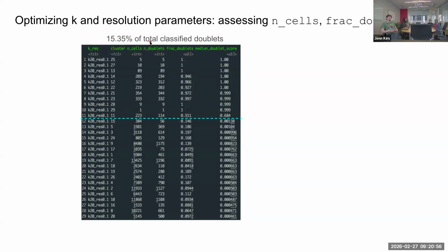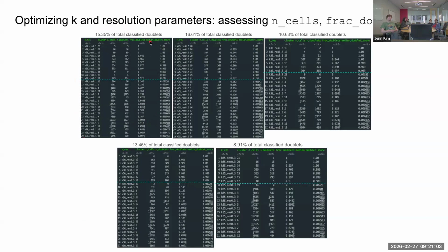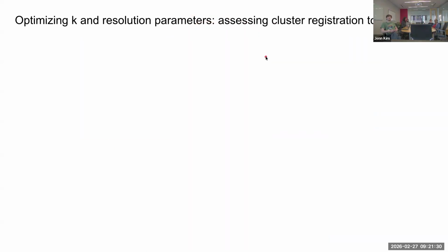So you can sort of assess your candidate K resolution combinations with this approach. So if we look across our data in a similar fashion and verify that these putative doublet clusters have high fractions of originally labeled doublets, then we can try to maximize this number, the total classified doublets that we dropped, which would identify this K25 resolution 0.2 as our best candidate to move forward with based off of these metrics. But then we can also use the actual registration to the reference dataset to calculate a number of different measurements to further assess your 5, or however many, candidate parameter combinations you're dealing with.